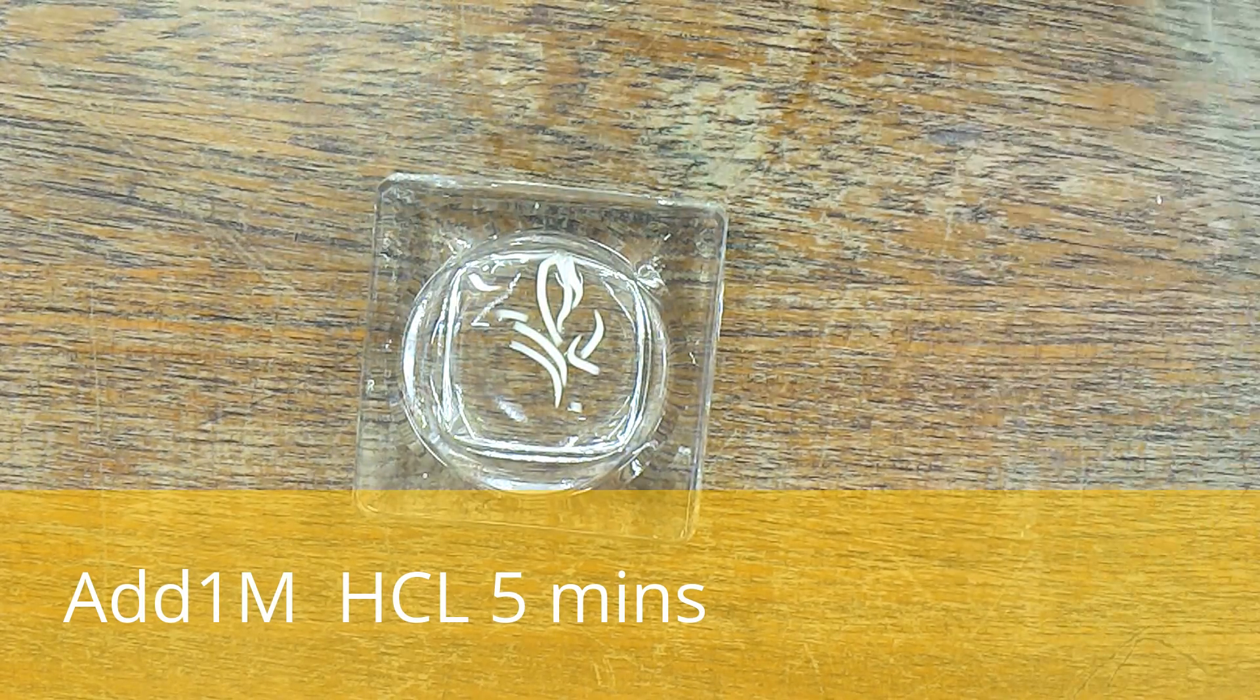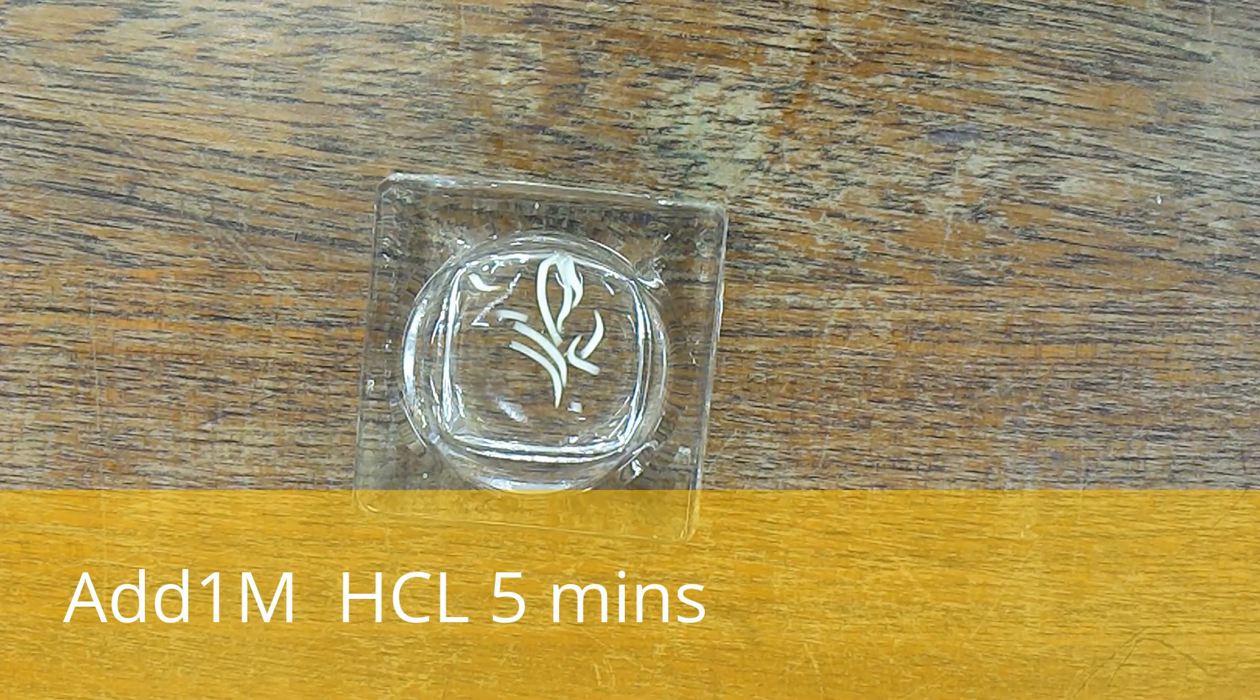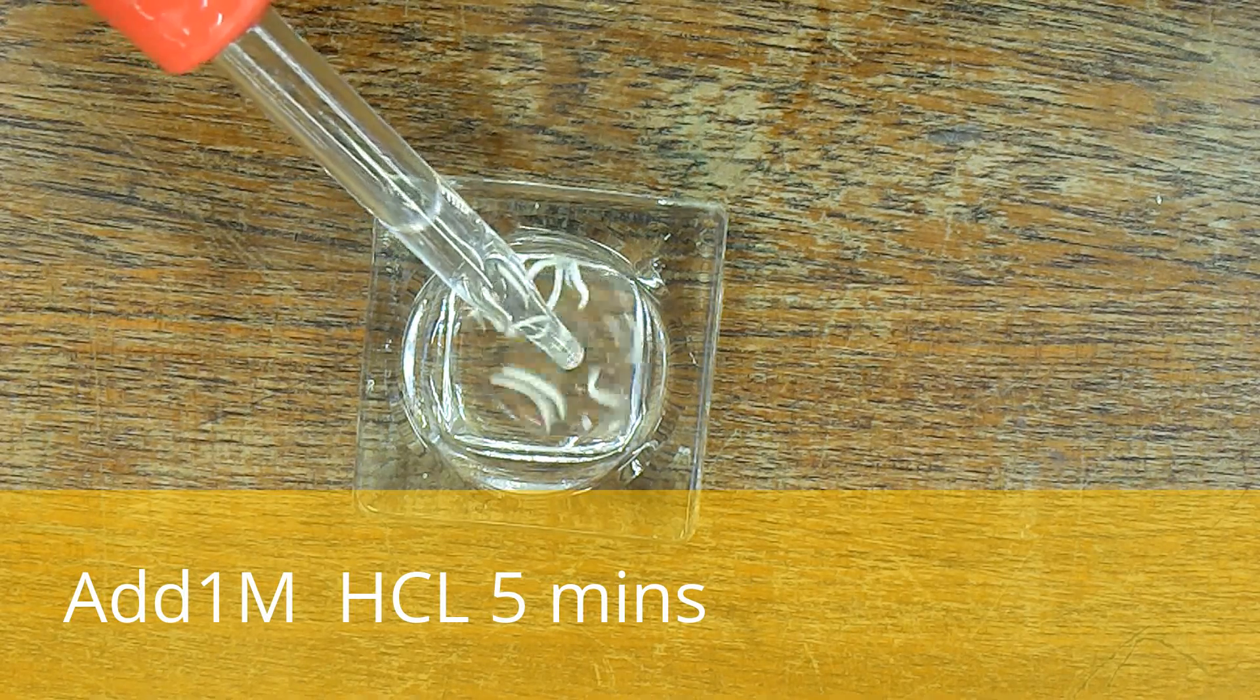I'm going to put hydrochloric acid onto those for five minutes, exactly five minutes.